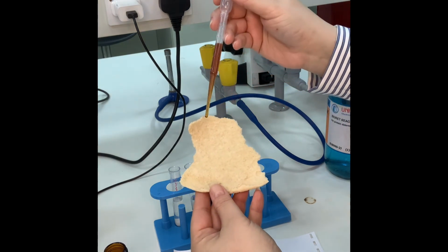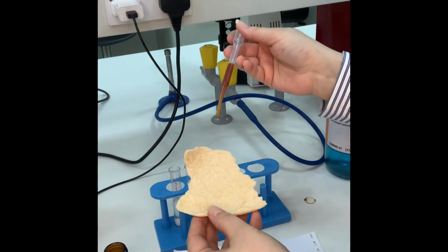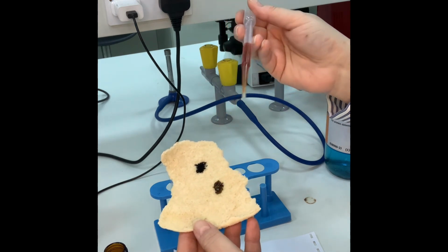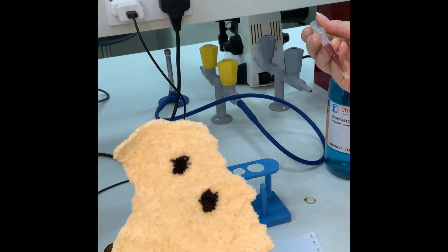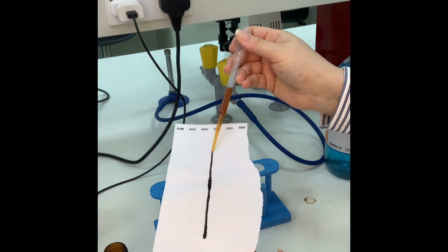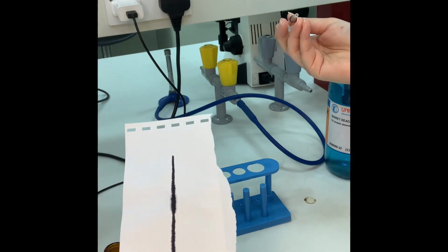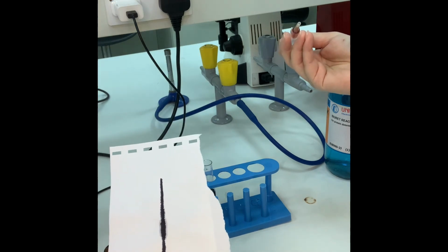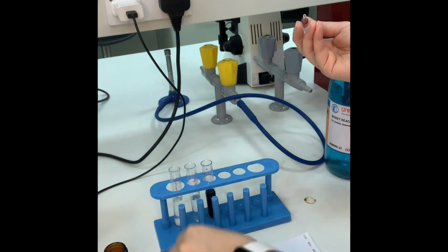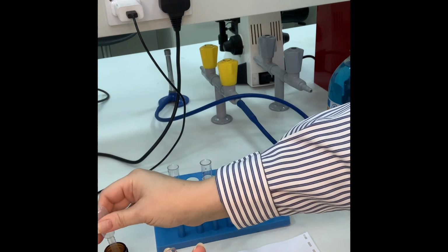Look at the bread, look at the brownish coloration over here. It's a brown, yellowish, orangey, whatever you like to call it. Look, if I add the drop, how it changed into a black blue coloration. Look at the A4 size paper, because paper is made from plants. Plants have cellulose. Cellulose is a polysaccharide, so this definitely comes from plants. This is the water. Nothing happens to it.